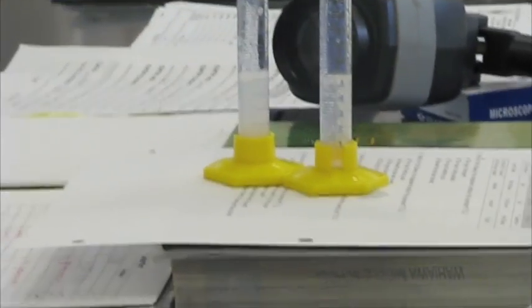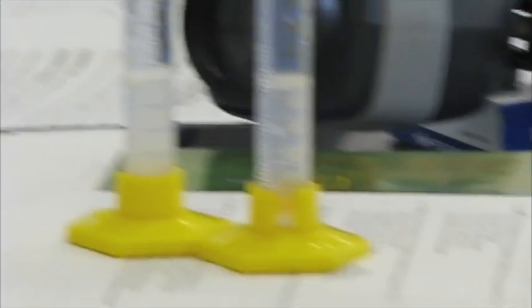After a few minutes, what I'm going to do is I'm going to add this. What was this again? Iodine. And iodine is going to react. Iodine by itself looks like this. What color is it? Brownish.